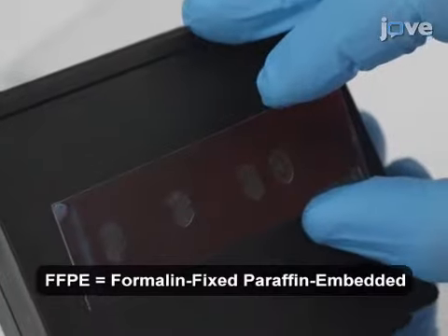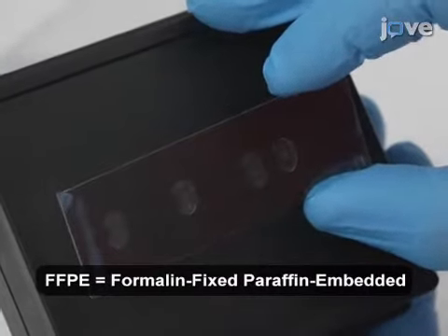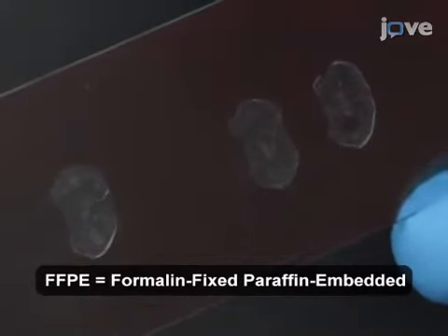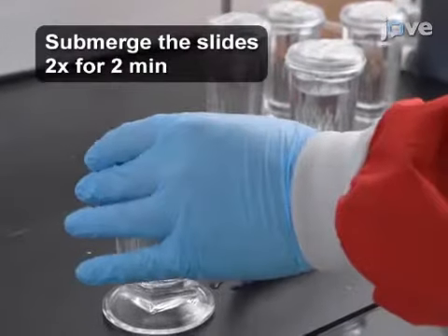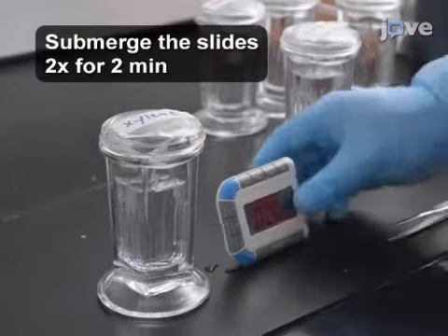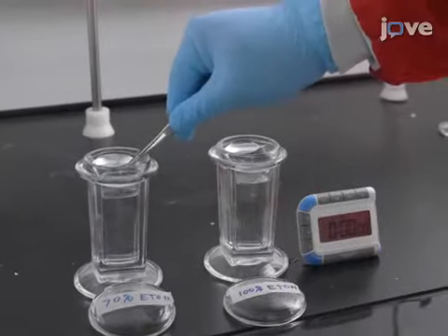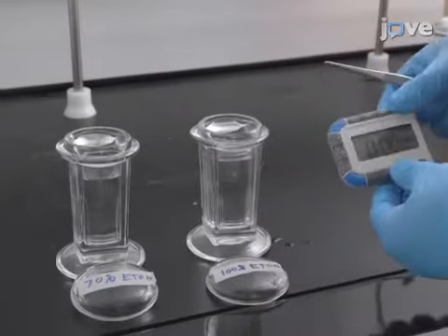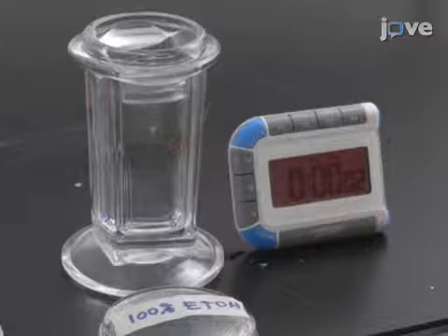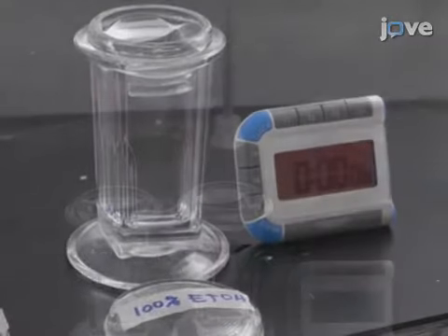For FFPE tissue, float mount the sections onto the nitrocellulose pre-coated ITO slides as described in the text protocol. Submerge the slides in fresh xylene to remove residual paraffin for 2 minutes. Wash the deparaffinized samples by submerging the slides in a graded solvent series consisting of a 70% volume for volume ethanol water solution followed by 100% ethanol for 30 seconds.